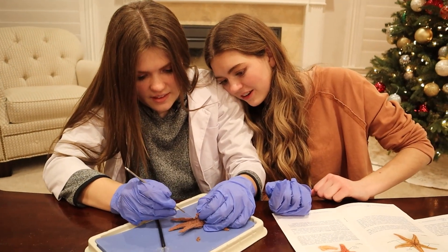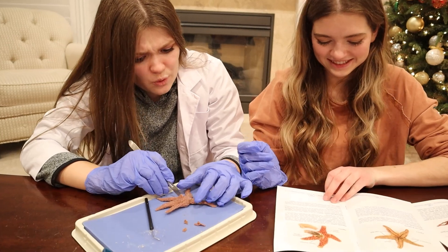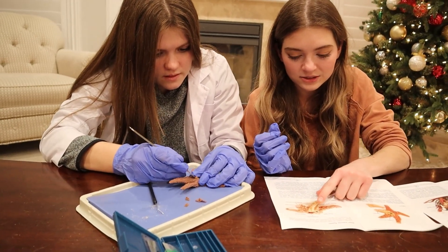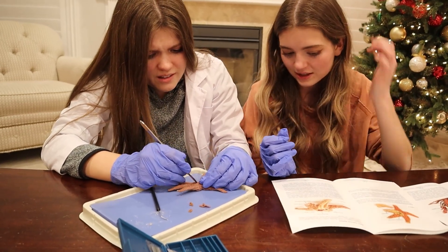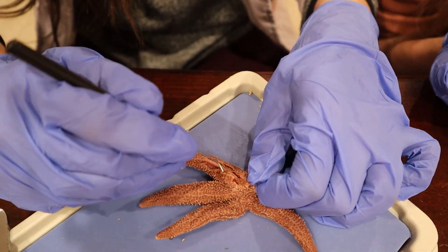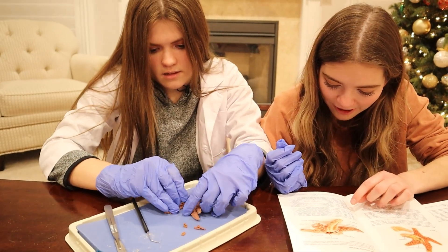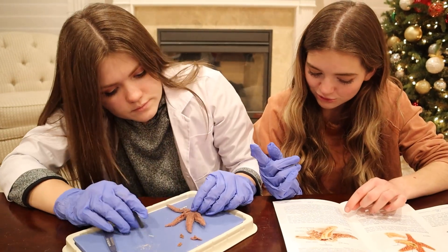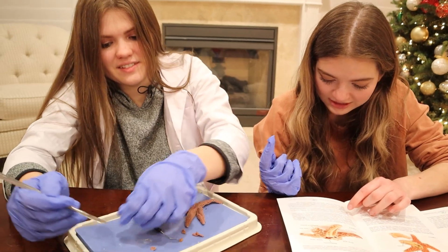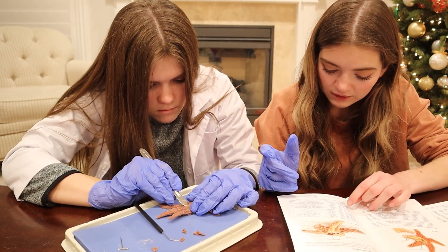Let's get to the middle. I'm trying to be careful — I don't wanna get in the splash zone. It's so squeetchy — the digestive glands are squeetchy. Once you remove it all, it shows all the different patterns. There's the ring canal, the stone canal, the tube feet, and the different grooves. Water is brought into the system through the sieve plate, passed through the stone canal into the ring canal. From the ring canal, water is distributed between the radial canals, one in each ray, connecting to the tube feet. The water is forced through to extend like tiny tentacles, and adhesive chemicals allow them to latch onto things. Then they release another chemical to let go.